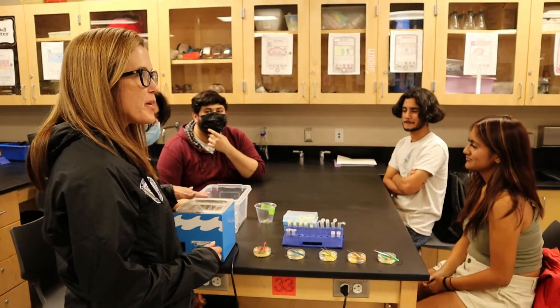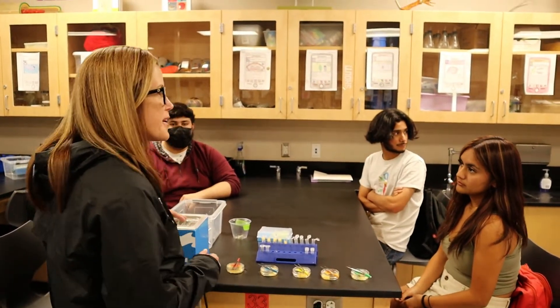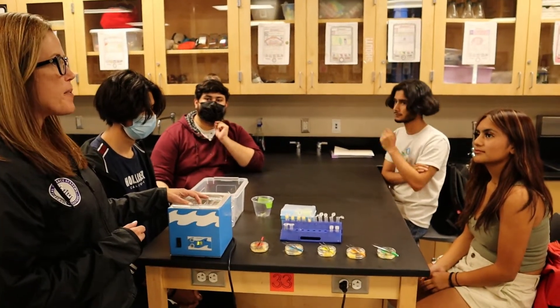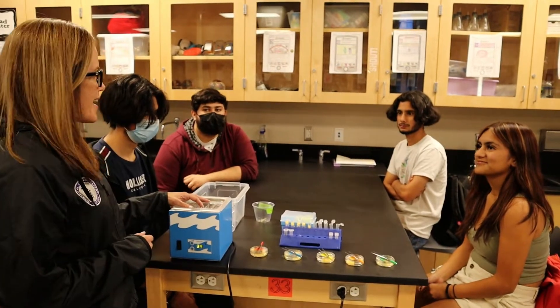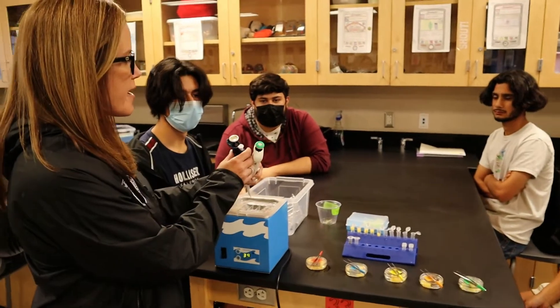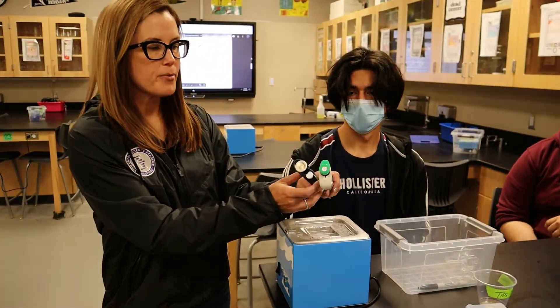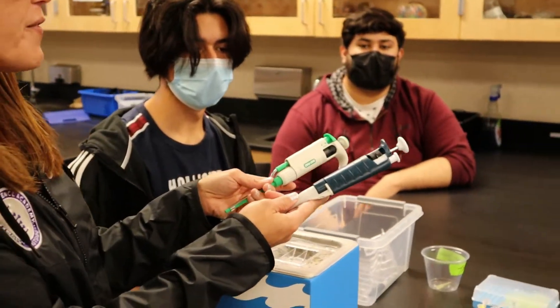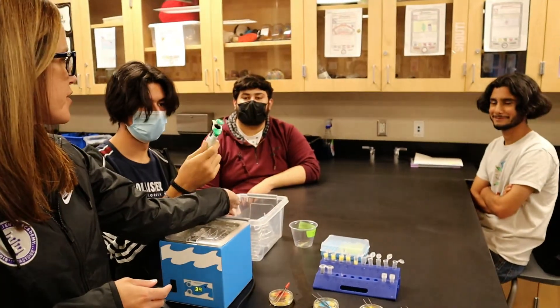We're going to combine steps three and four for this next section. You're going to need a micropipetter and we'll need to set it to 50 microliters. So I need you guys to decide which micropipetter would work best for that. You have two options: a 2 to 20 and a 20 to 200 microliter option. Which one should you use in order to transfer 50 microliters? Go ahead and set that to 50 microliters.